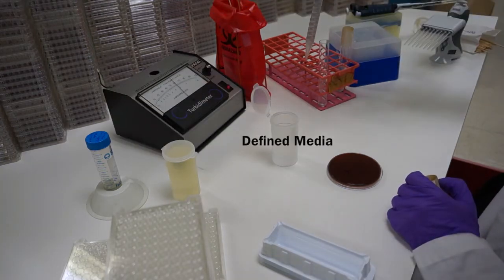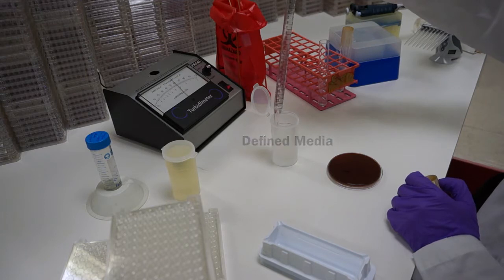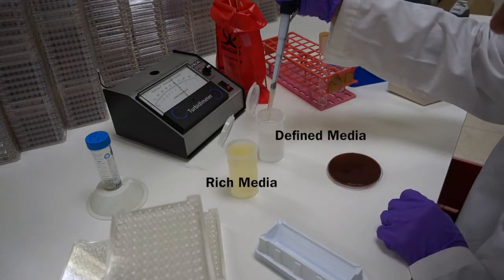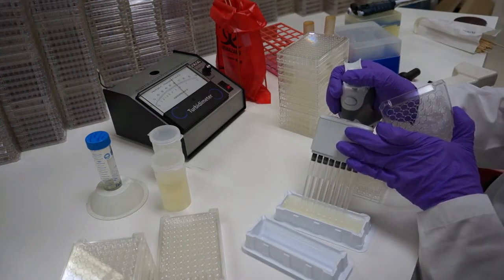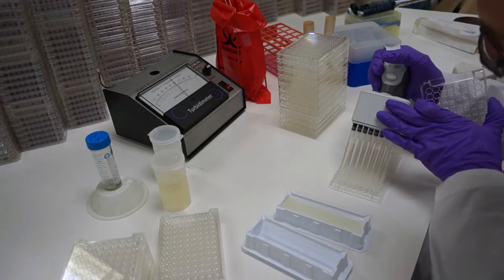Add a portion of the suspension to a defined media. Next, transfer a portion of the defined media suspension to a rich media and dispense into PM plates 9 through 20.